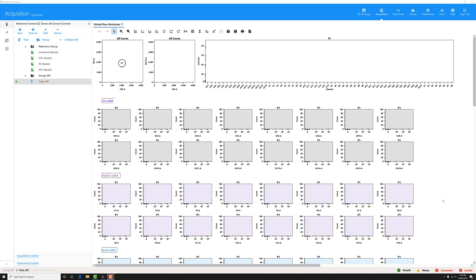SpectroFlo version 2.2, we've introduced a couple of new reference control QC features for you. So I'm going to walk you through how those work. First, I've made an experiment here where I've recorded a reference group. Everything here is beads just for the sake of demonstration. I've got unstained beads, FITC single stain beads, PE beads, and APC beads.